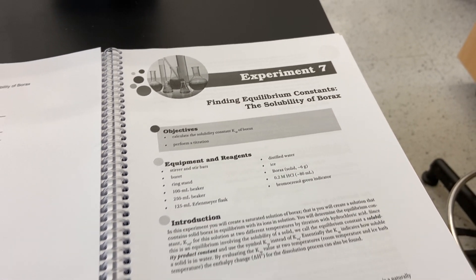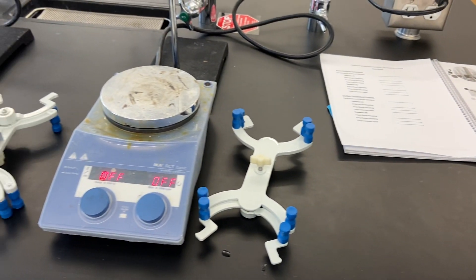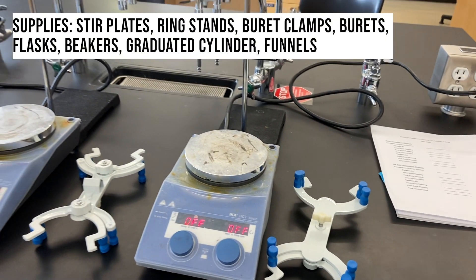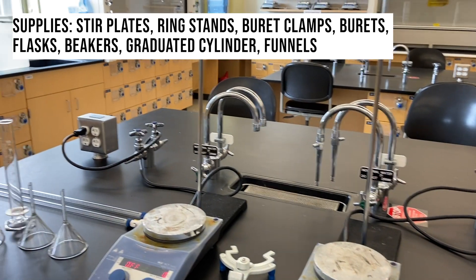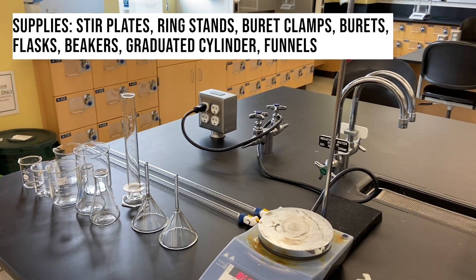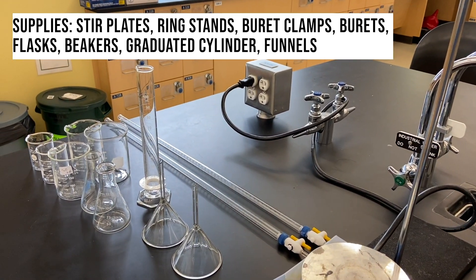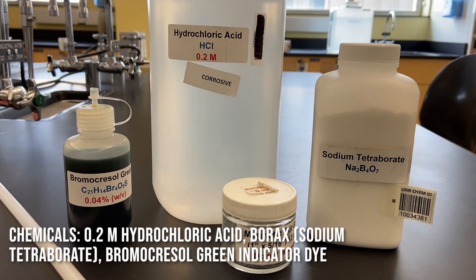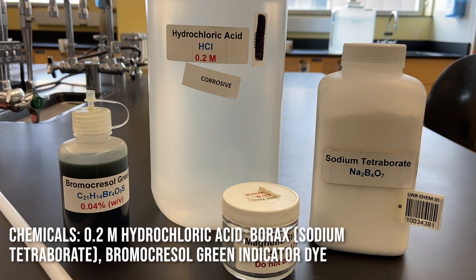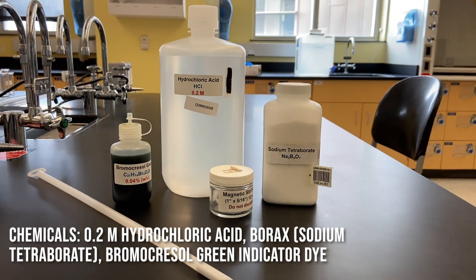Today we will be exploring equilibrium constants through the solubility of borax. To do that we will be doing a couple of titrations. We've got a setup of ring stands, stir plates, some burette clamps, and of course some burettes and other standard glassware. The chemicals we'll be using are 0.2 molar hydrochloric acid, bromocresol green dye indicator, and sodium tetraborate, also known as borax.